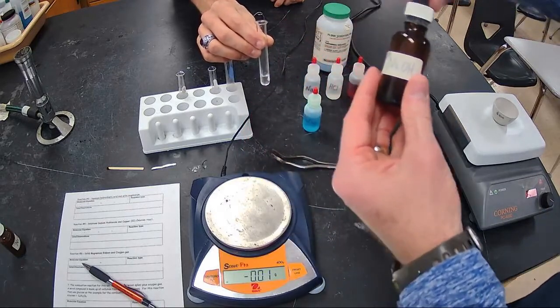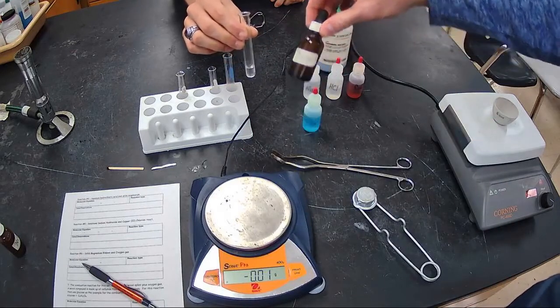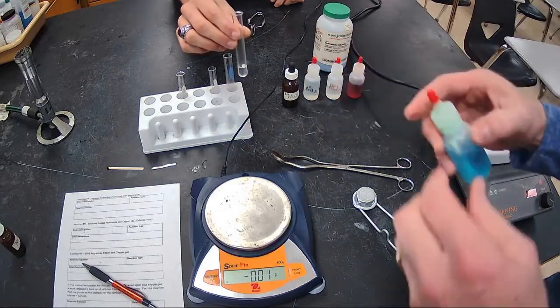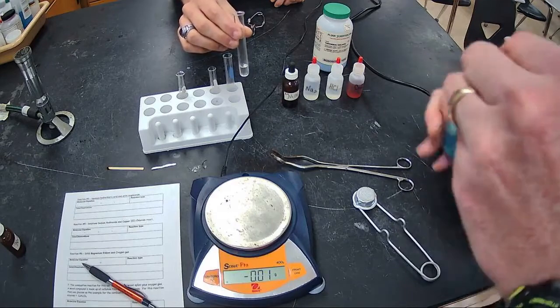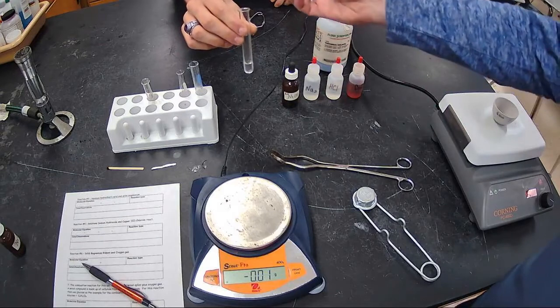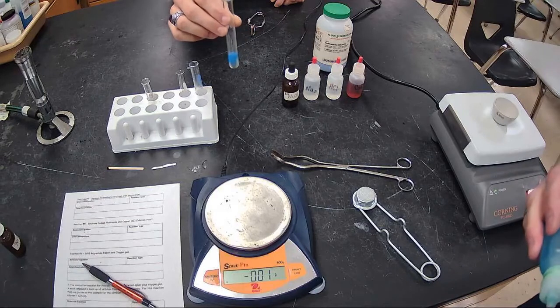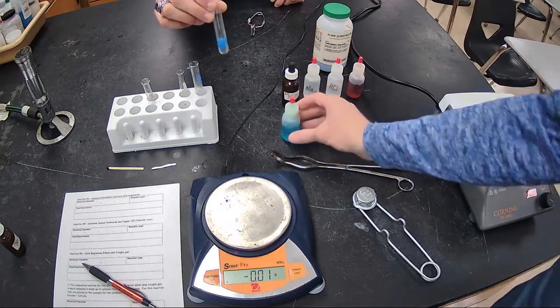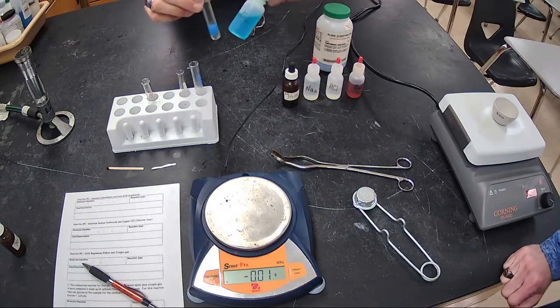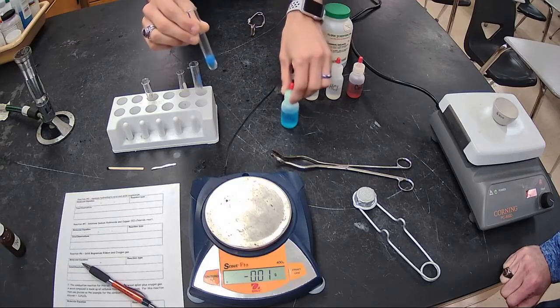So again, we have a clear aqueous solution of sodium ions and hydroxide ions. We're putting that in there. And now we're going to add some copper 2 chloride to that. And you can see if this reaction is fast, is it slow, what is it? And we're going to see immediately we get a reaction of the sodium hydroxide and the copper 2 chloride. I seem to see a resemblance. This is blue and now the product has blue in it.